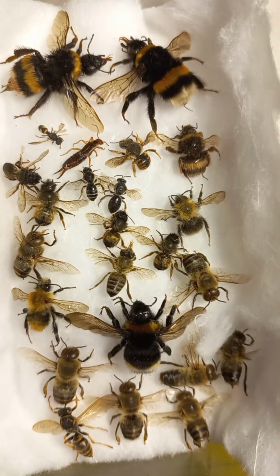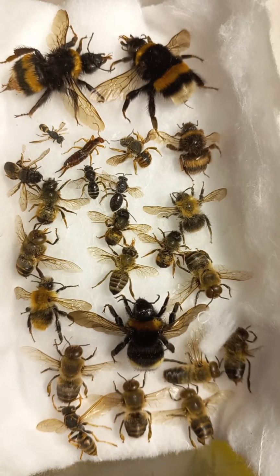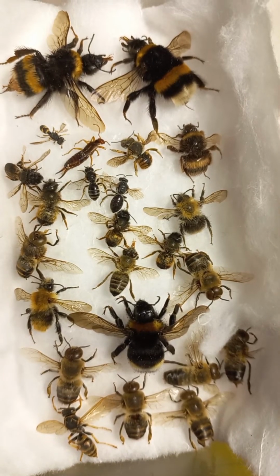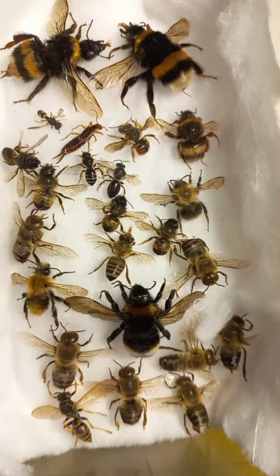Sometimes I'm showing different creatures, but today we will be talking about bees and bumblebees, about social bees and solitary bees and social bumblebees. Why? Because some people are interested in the structure of different insects. The structure of insects is different in different orders.